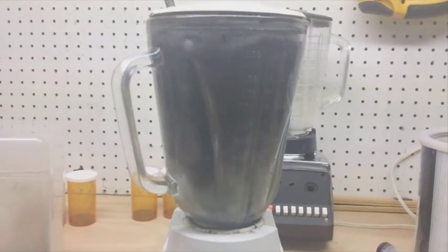Acetone will pool on the ground, and because acetone can flash over, I'm in my basement and I have a gas water heater. If the vapor concentration gets high enough, it could cause a flashover. Not sure if that could happen with something this small, but that's a significant amount of vapor into the room, so I've got to work out a way to vent this.